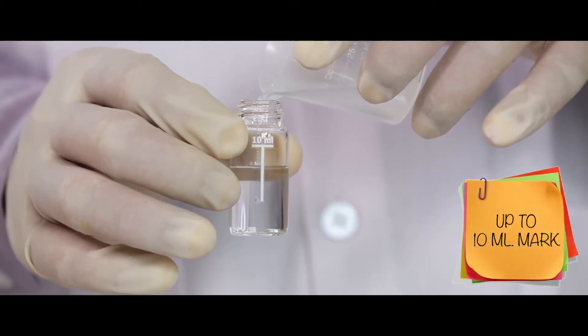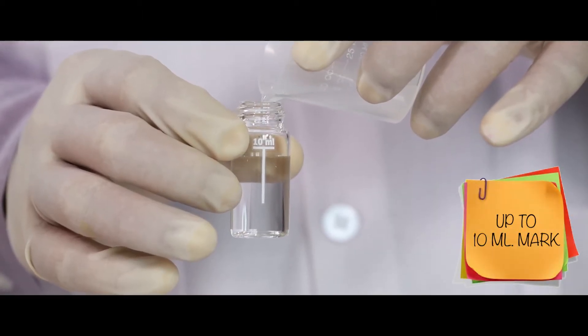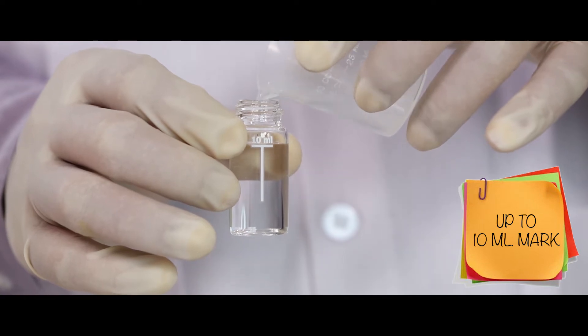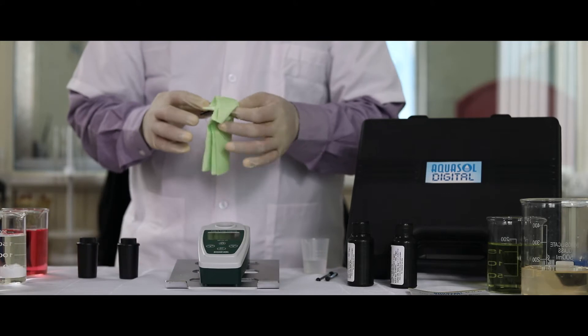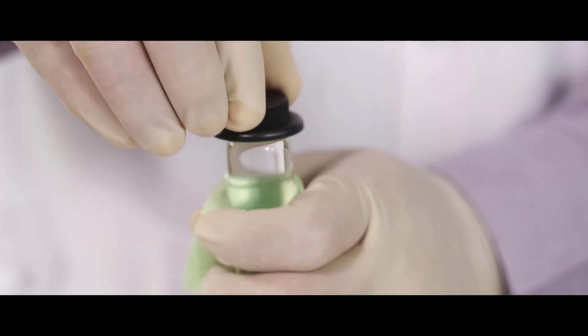Fill the sample in the glass bottle up to the mark. Clean the exterior of the bottle.